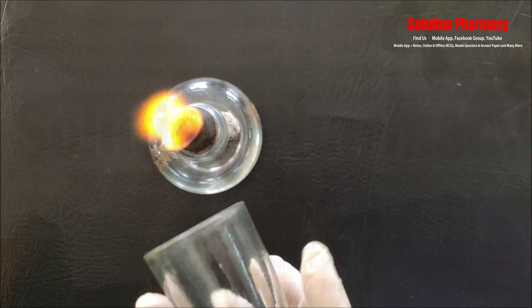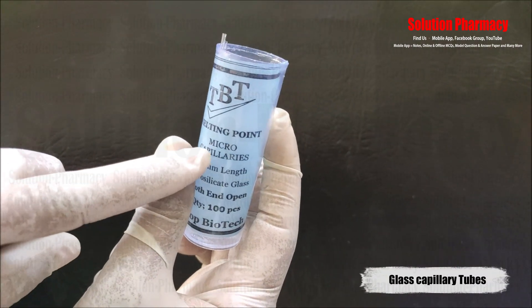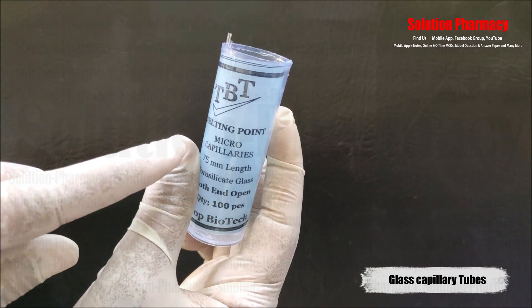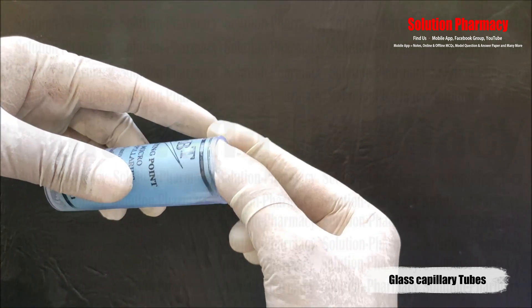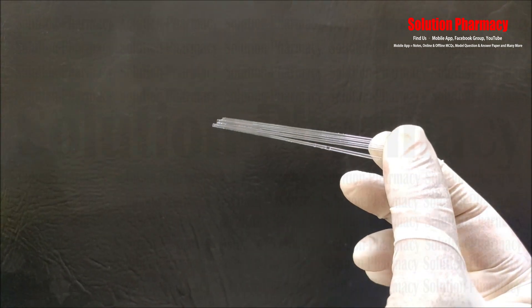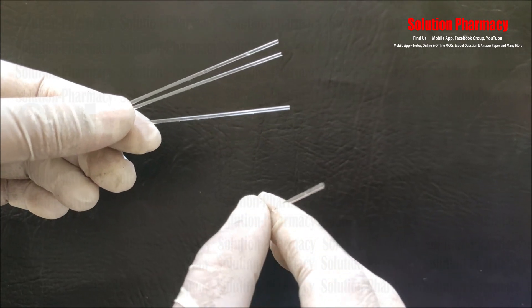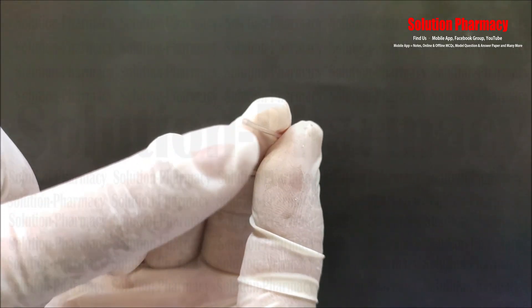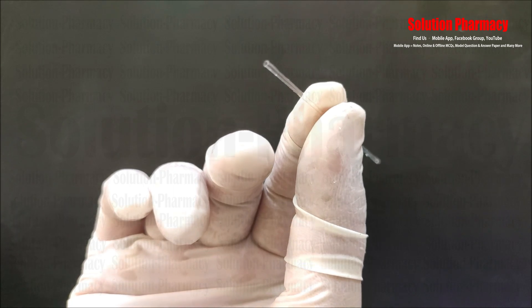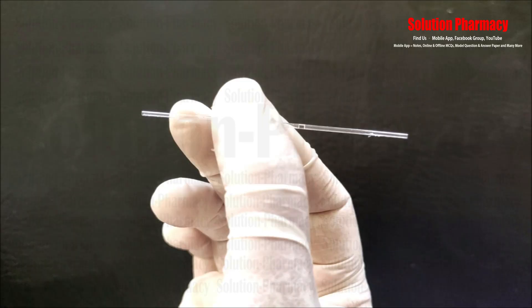Next, this is called a capillary tube. This is a micro capillary tube of 75 mm length, made up of borosilicate glass with both ends open. It is a very thin glass tube, and as you can see, both ends of the capillary tube are open.